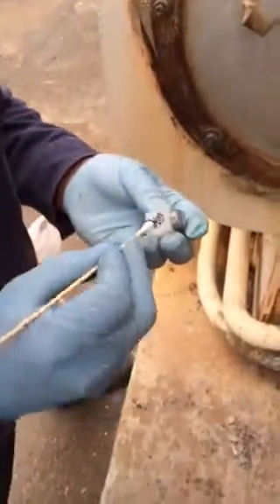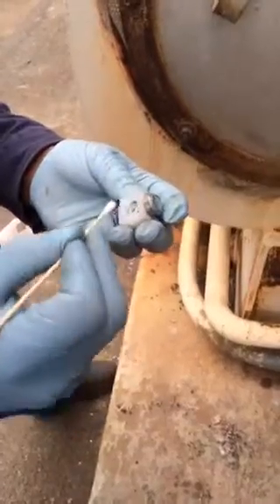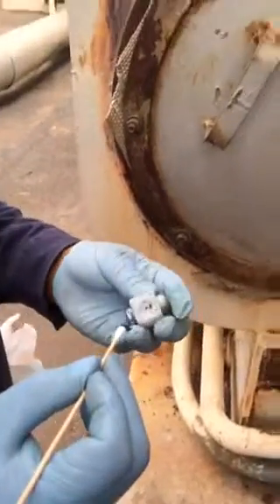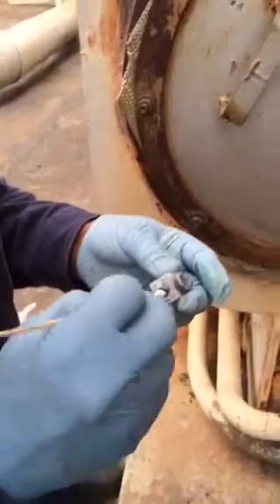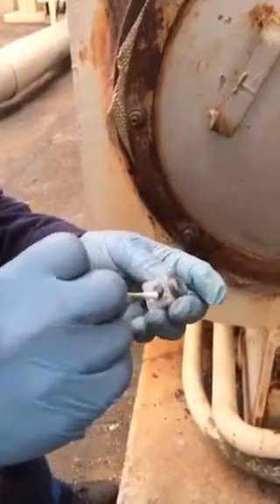Look at that crustiness up there. So I'll get some DI water and flush all this out. That might take care of it right here. That diaphragm — I think I might do it.